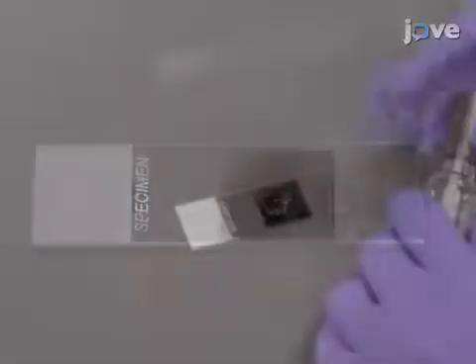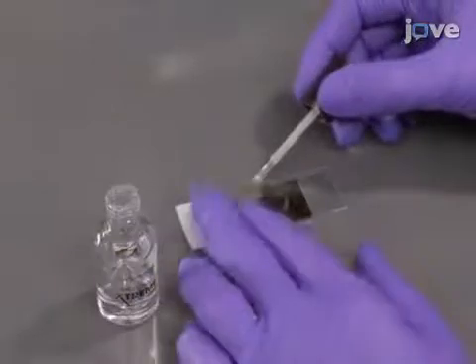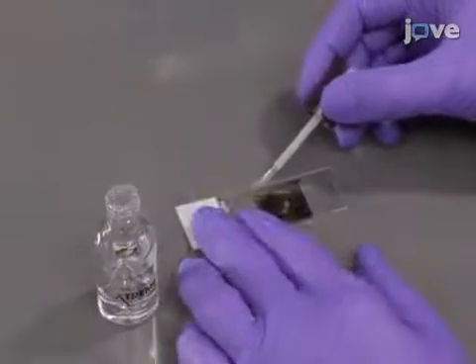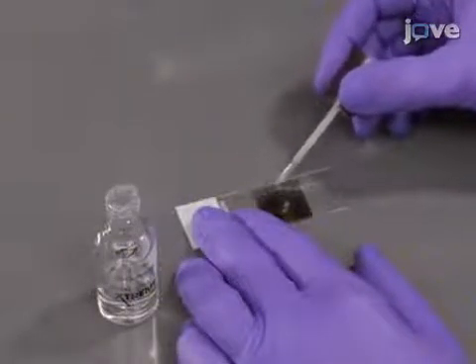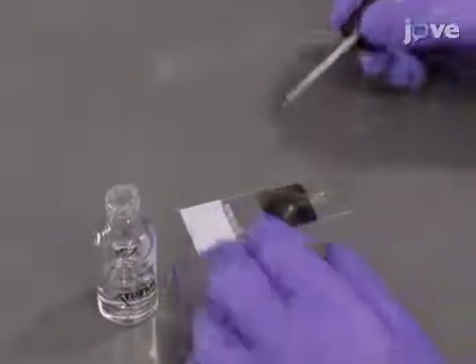Allow the slide to air dry for five minutes, then apply a light layer of nail polish to the cover slip border to form a seal and preserve the india ink stain.